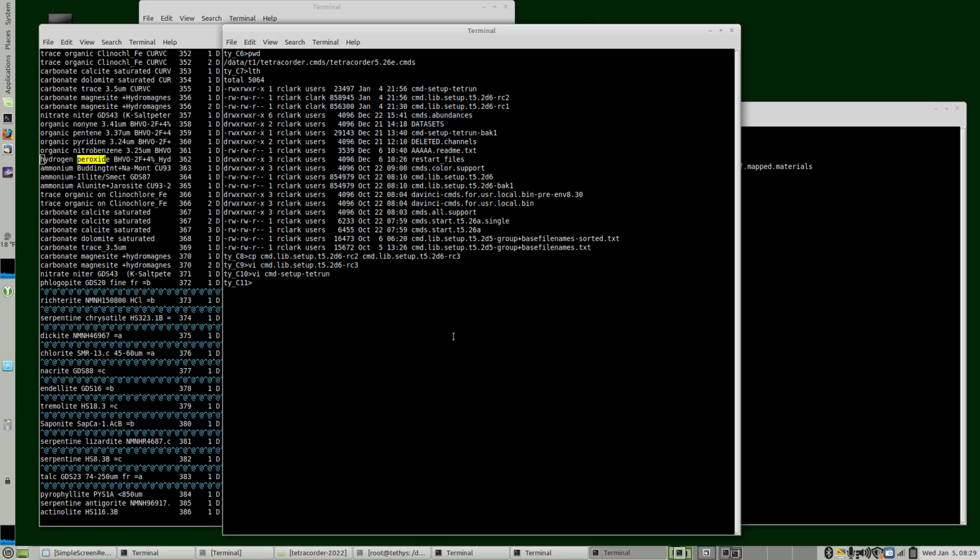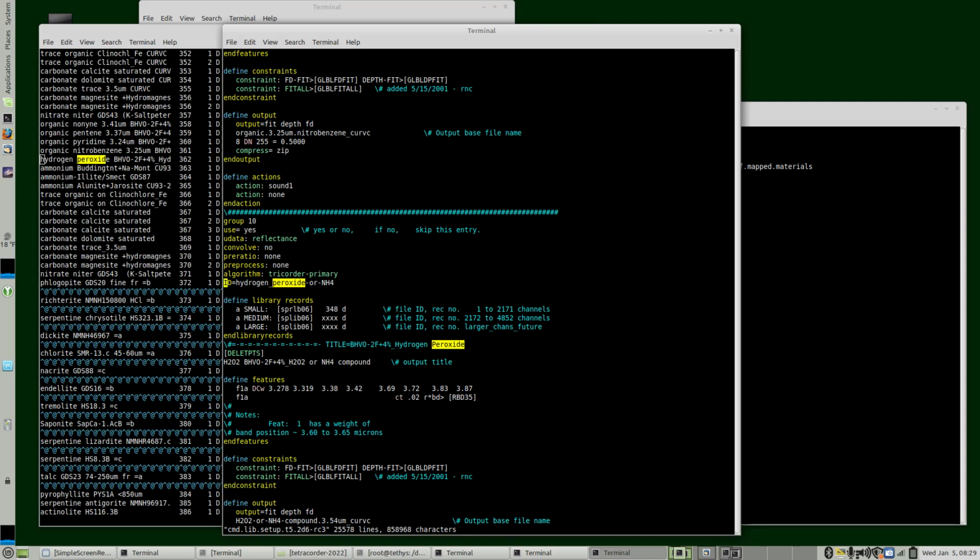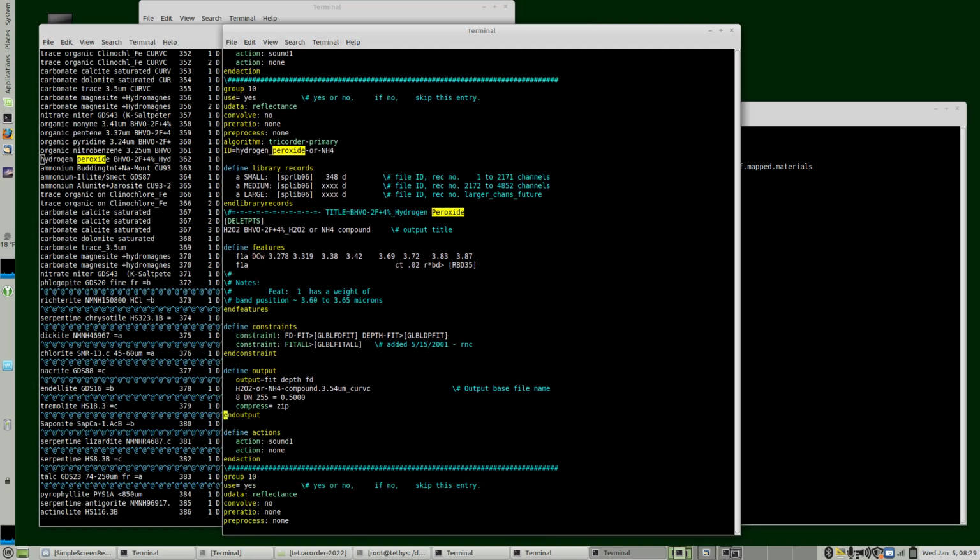To further refine this, we would need to make more measurements and see what the total range of ammonium features are. Also, these are room temperature hydrogen peroxide and ammonium spectra. If we were working on other planets, hydrogen peroxide is found on Europa, Jupiter's moon. So we also need at least one low temperature spectrum, and we have that. I've added that to the research library, and I'll incorporate that into a future version of the expert system. And then we would also include a constraint on temperature. So we don't have any constraints on temperature here, but we would add a constraint for low temperature versus high temperature compounds.